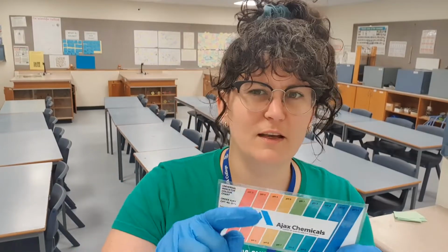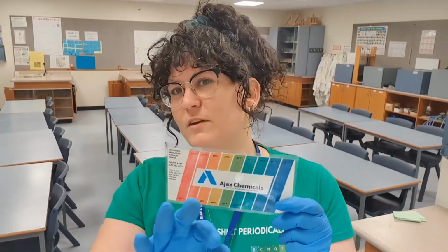Are you with me? If you're not with me, stop the video and figure it out, because it's a really important part of the prac. Okay, so let's get this set up. I'll show you what I've got going here.